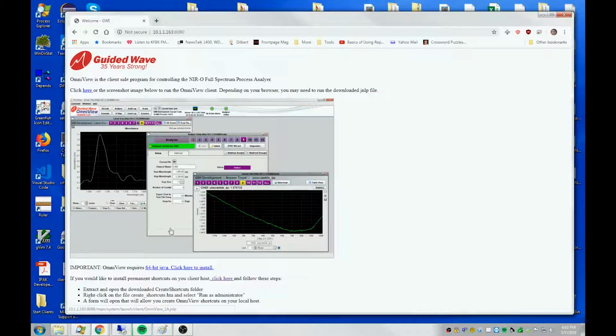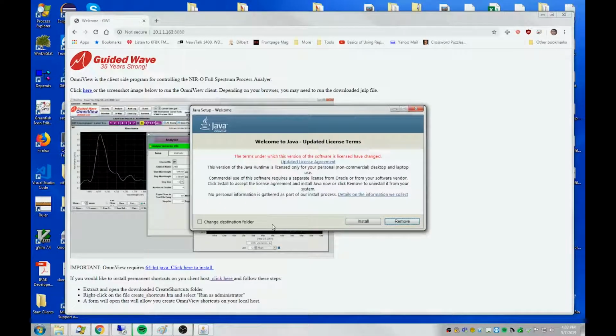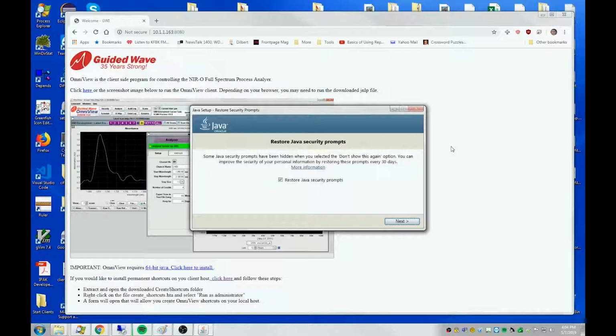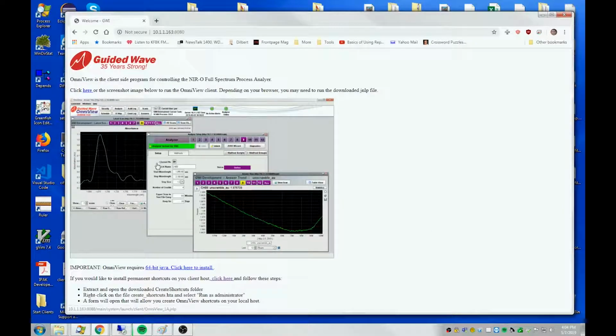To run a JNLP file, you do need to have 64-bit Java. If you click on this link, we download an installation file from our server and just install in the standard location. Don't change the location. Java has installed. Now that we've done that, you should be able to click on this image here.